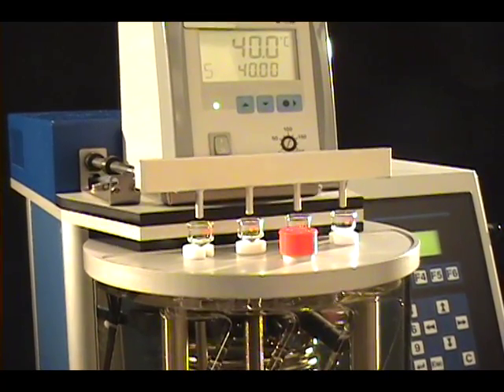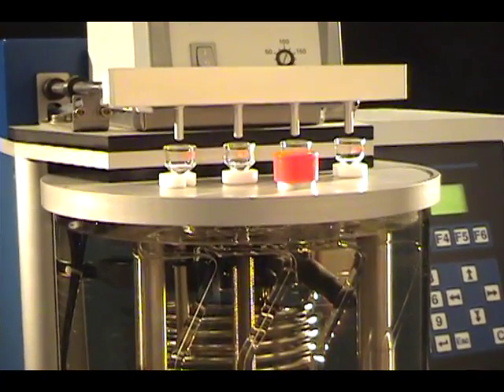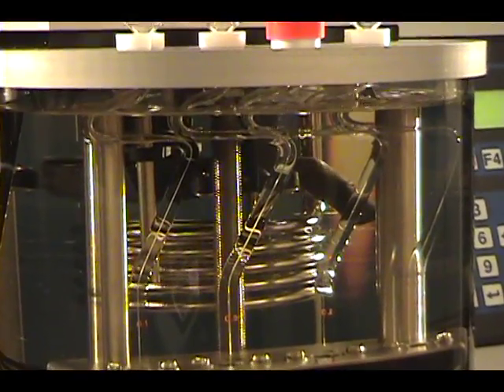Replacing a tube on the Spectro-Visc is easier than other viscometers on the market due to the fact that the optical sensors are not connected to the tubes and that draining of the bath fluid is not necessary. Replacing a tube can be performed by anyone in a matter of minutes, significantly limiting downtime.